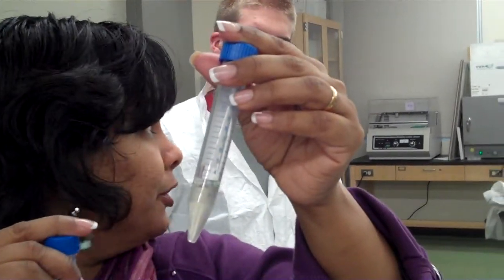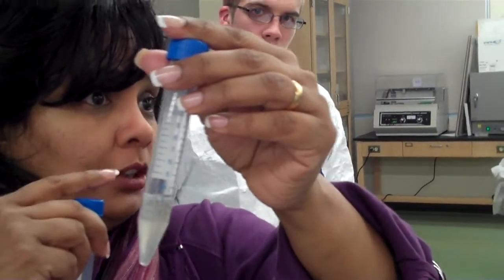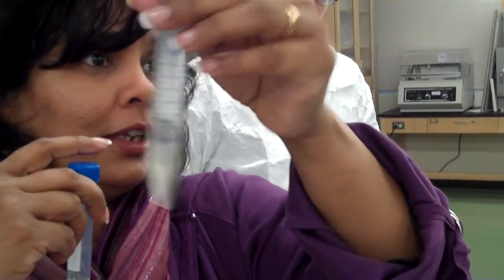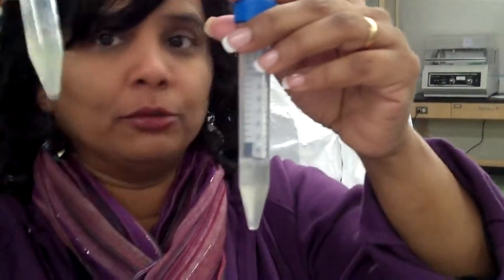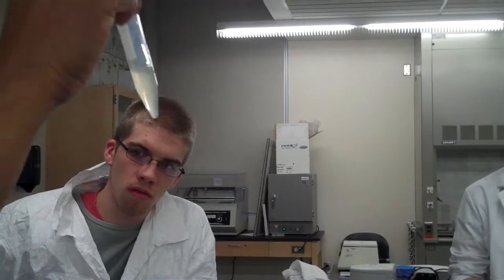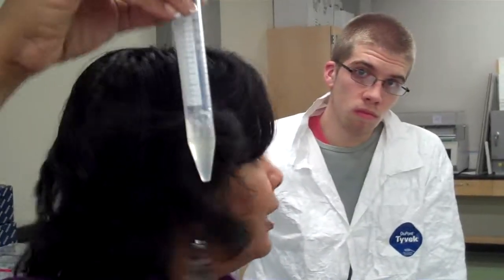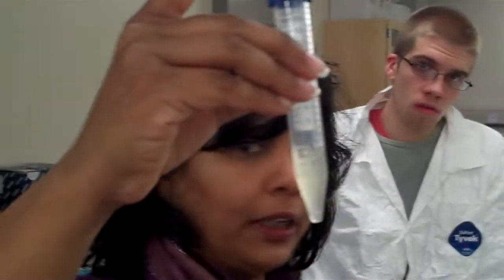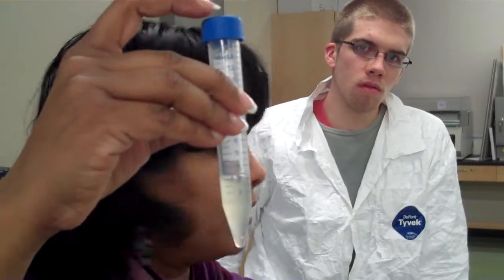In fact, remember what I told you, that you could put it into the incubator and turn the shaker on, and it would shake like this for an hour, and it would really grow fast, and then it would turn into this. So you want it to grow to high turbidity. This is said to be turbid. It's a term we use in everyday language. See, these are not quite where they should be. They can grow a little bit more, whereas this one is definitely ready. You see the difference? Okay, so that's what you want to do.